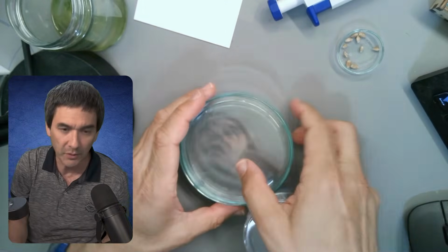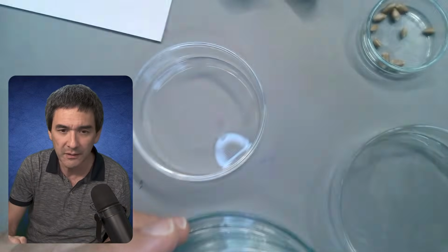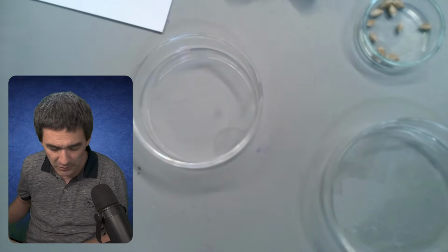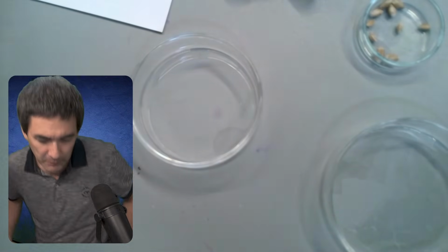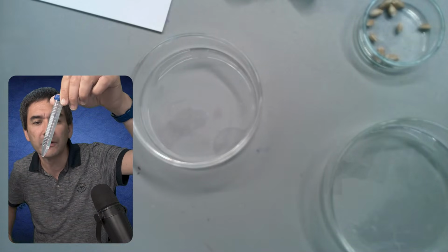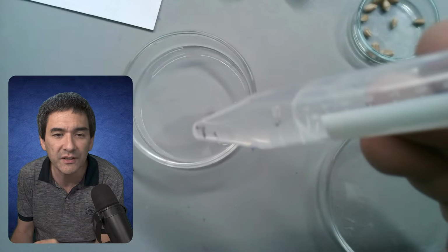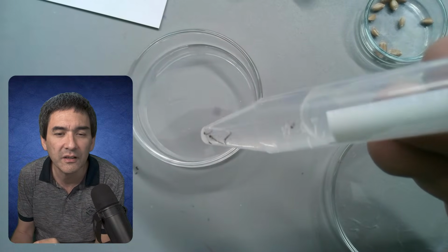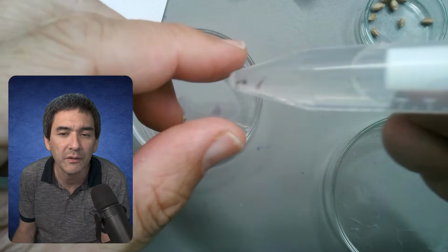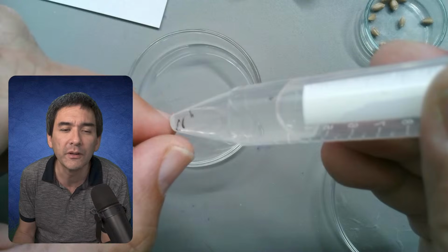Here we go. I've got a couple of Petri dishes here because it's much easier this way. Let's turn off the lights here as well. And let's have a look at a couple of those larvae over here. I'm just going to show this to you. Let's focus this. You can actually see that there are 3 of them in here. There's the 4th one over here maybe. Let's have a look at those.